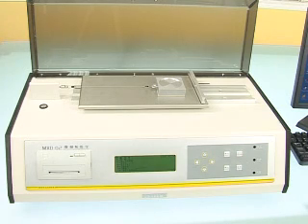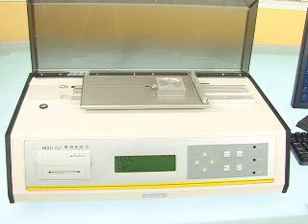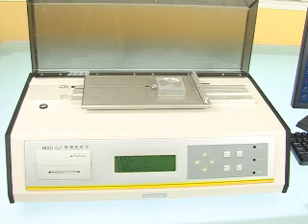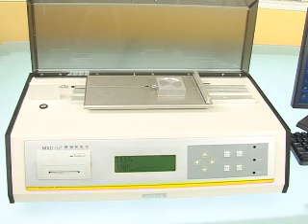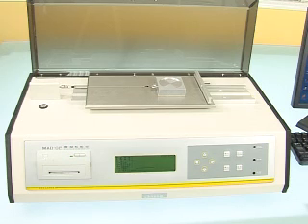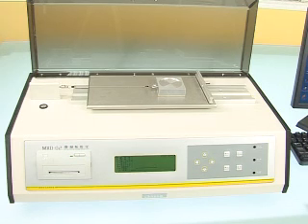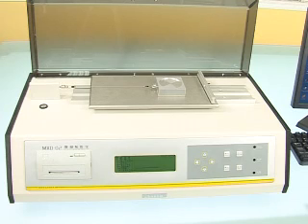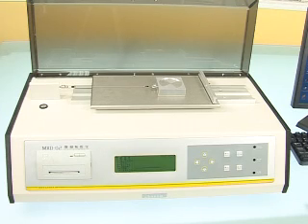A standard communication port, RS232, allows communication with a computer. Professional software supports original data re-analyzing, repeat analyzing, and printing batches of curves in one graph.